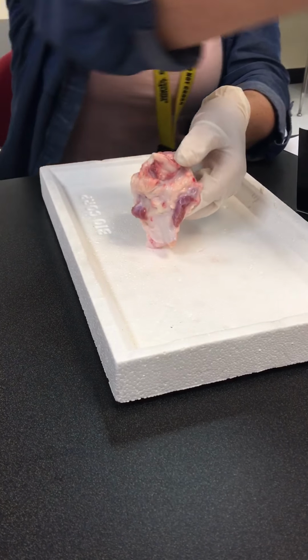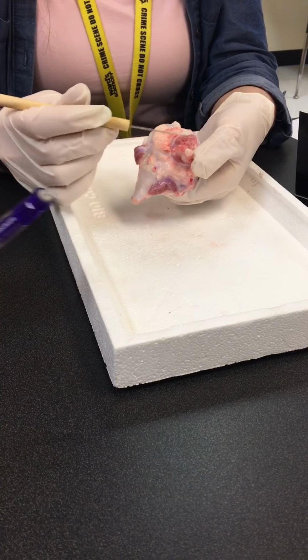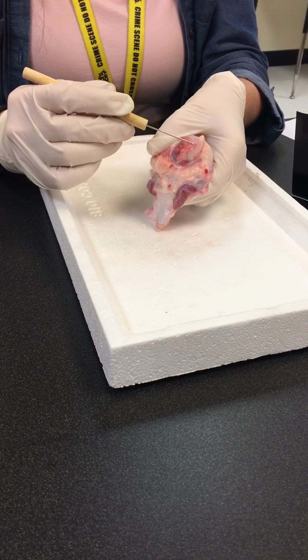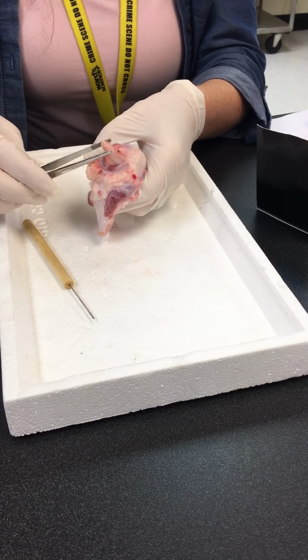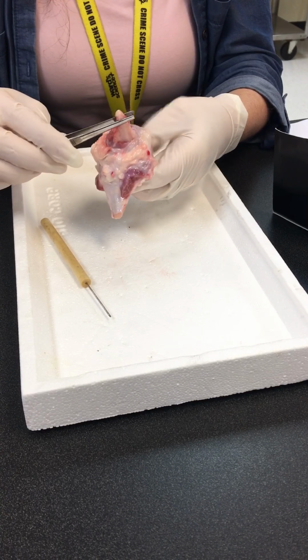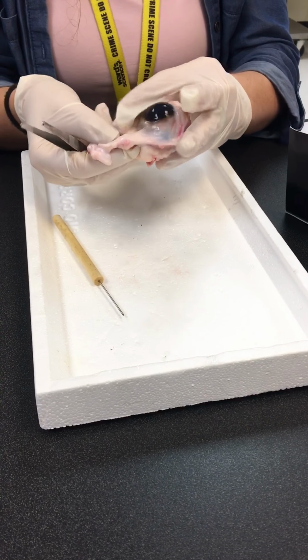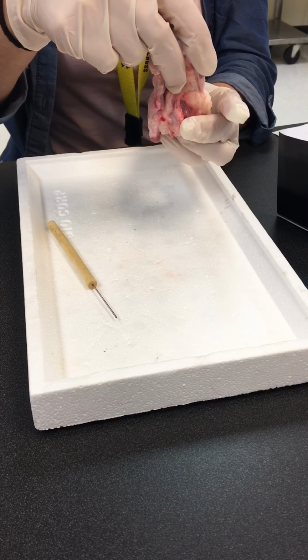What's that little ball right there? It looks like it's hard. That's what I was getting ready to point out. Anybody want to guess what this is? It's the optic nerve. Okay, that is your optic nerve. It's very tough. You don't have to write anything; this is just if you want to remember anything. Now, this is in the exact posterior portion. So here's the anterior, and the optic nerve is right behind it in the very back portion.